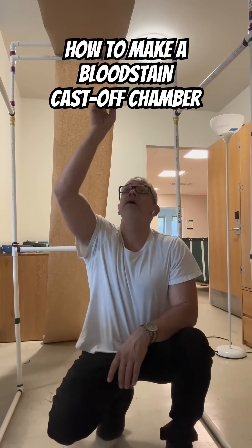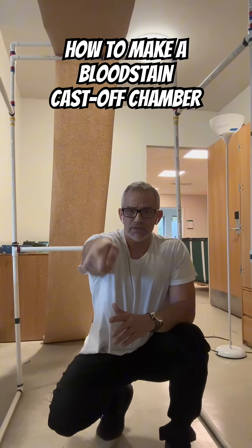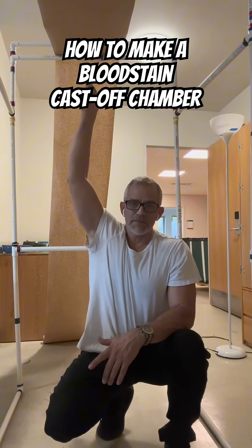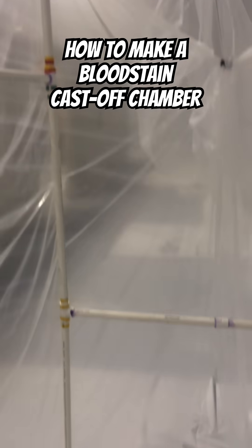You can see I have paper behind me, above me, and it would be in front of me. So when I'm doing my cast-off stains, the stain would be coming off the front of my object, up on the top of the paper, and then on the back of the paper, and so forth.